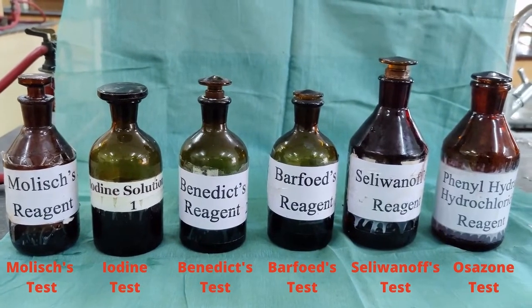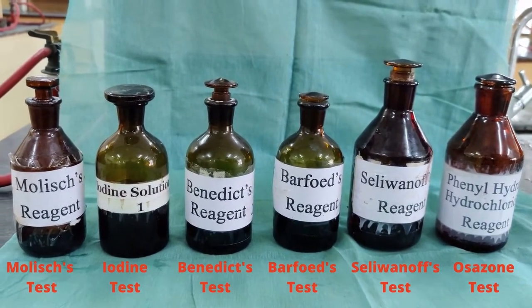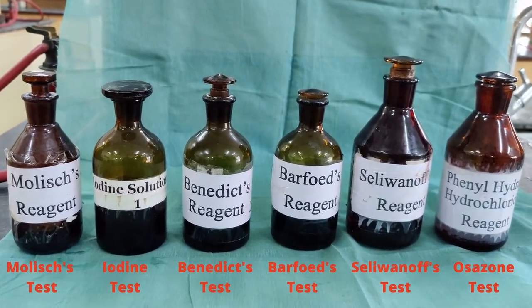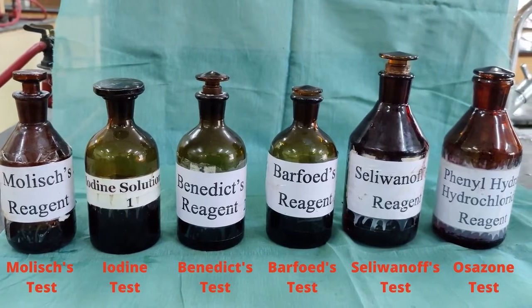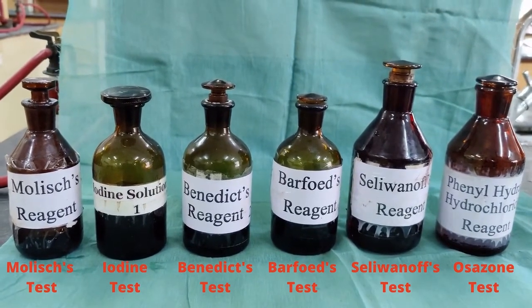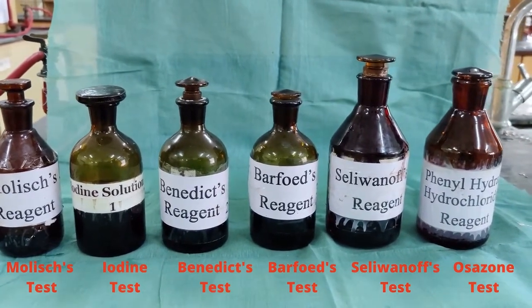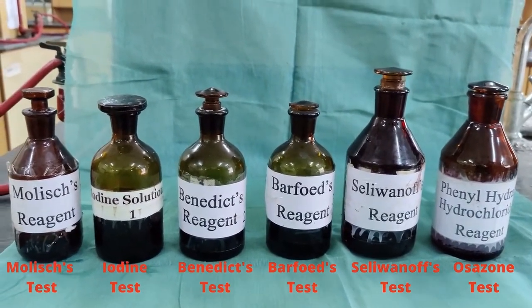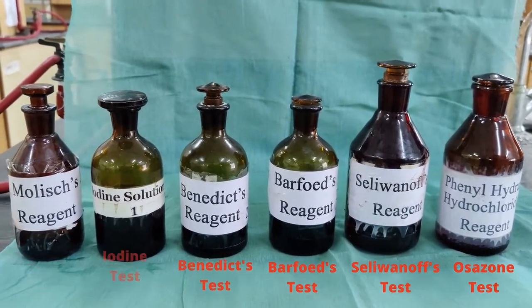Barfoed's reagent is used in the Barfoed's test. Barfoed's test is used to differentiate between monosaccharides and disaccharides. Seliwanoff's reagent is used in the Seliwanoff's test, which is used to differentiate between aldose and ketose sugars. The last one, the phenylhydrazine hydrochloride reagent, is used in the Osazone test, which is a confirmatory test.